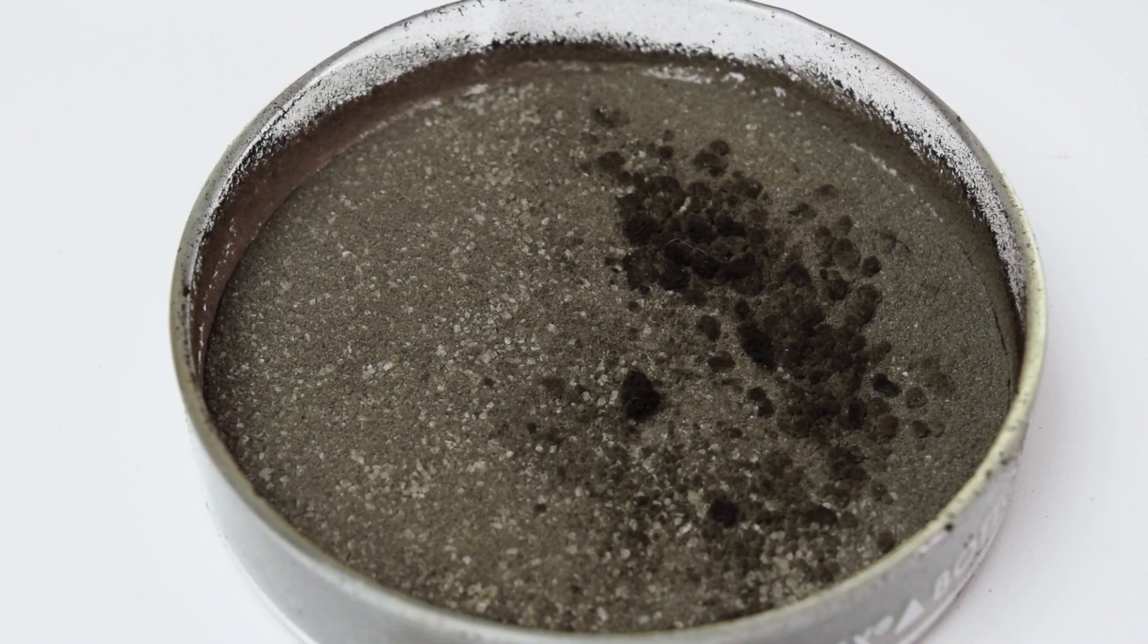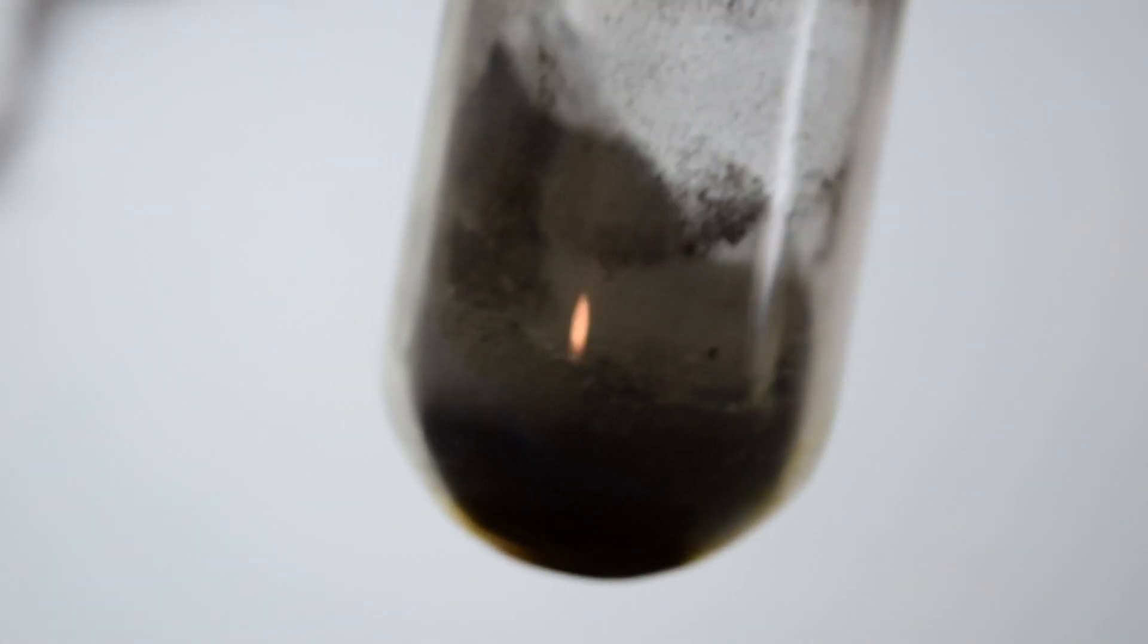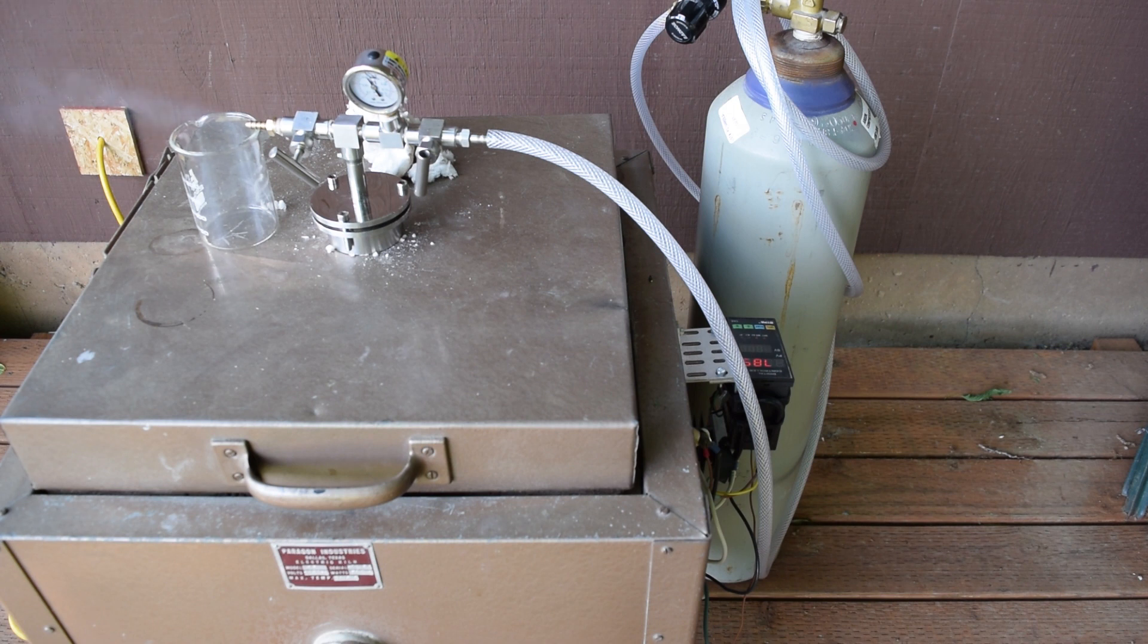After being ground, the mixture will need to go through its final process in a kiln at 800 degrees Celsius under argon flow for one hour.